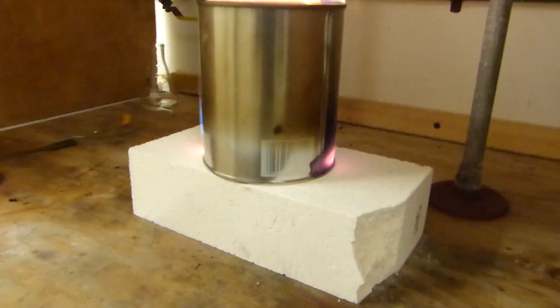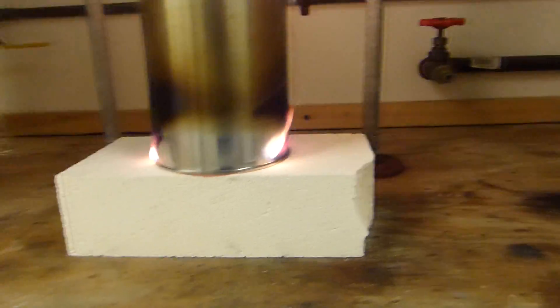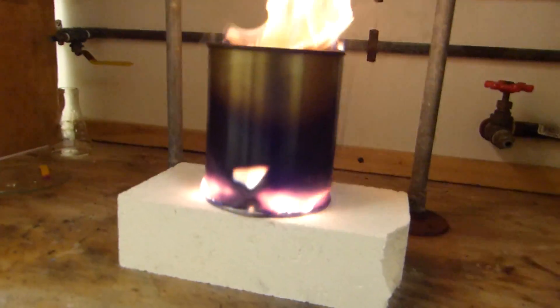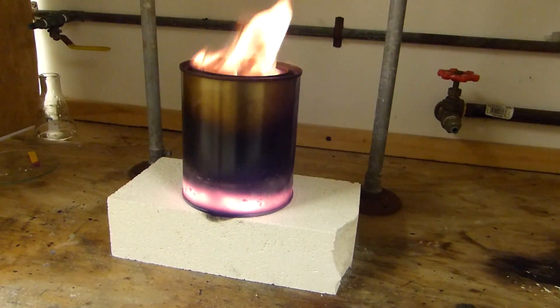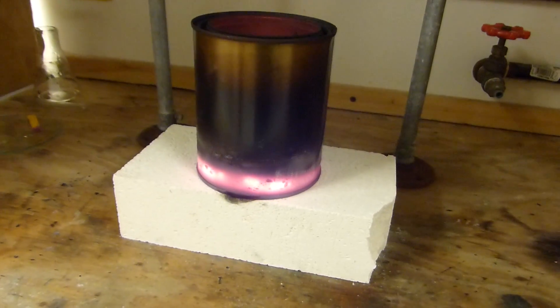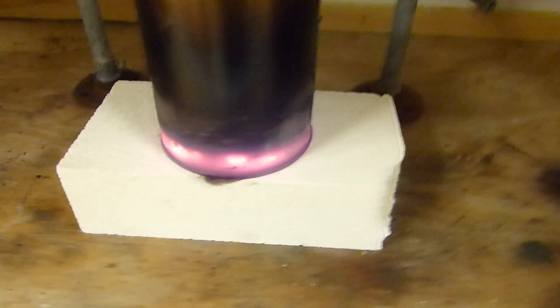And the mixture inside, if I can bring the camera up, is actually glowing. You can see there as it slowly burns. You can see the outside of the can getting really hot as the reaction progresses around. It'll be cool when the reaction gets to this side. Oh here we go. It's really going now. I'm actually going to unplug my temperature controller. I forgot I left it in there. There we go. And that's about it.